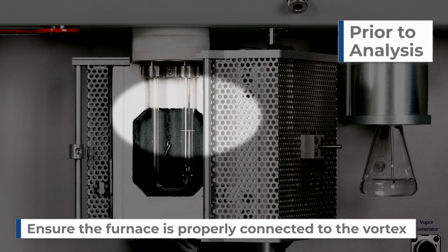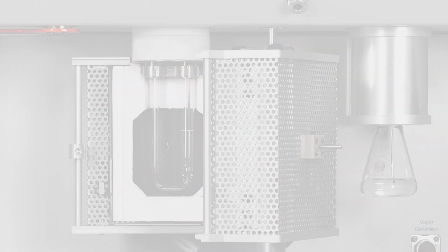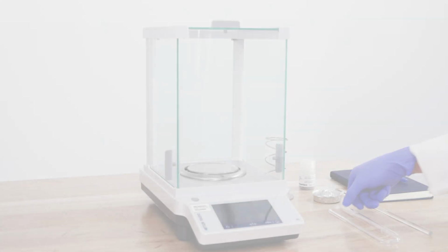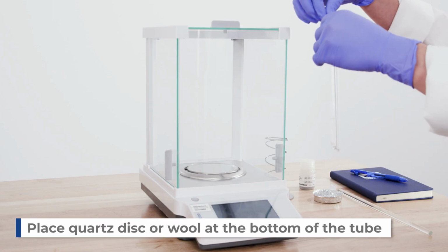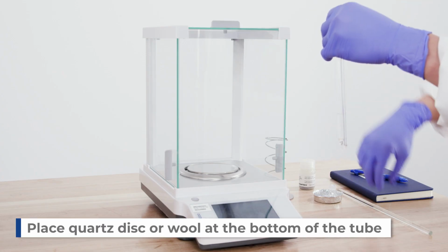Ensure the furnace is properly connected to the vortex. Now we are ready to prepare the sample. Place a quartz disc at the bottom of the sample tube with the provided glass rod.